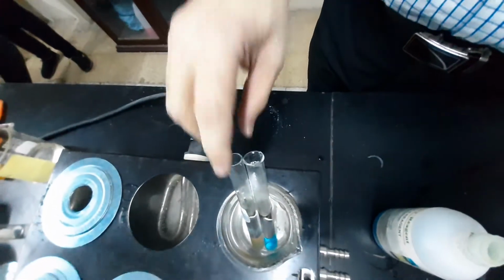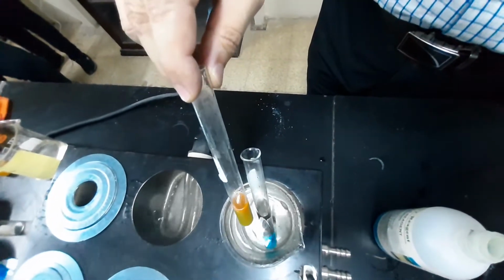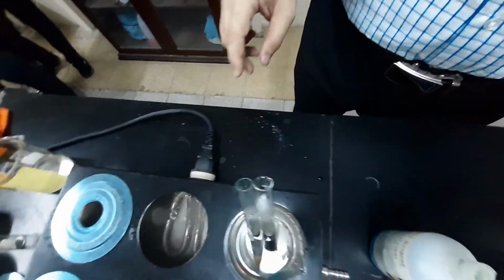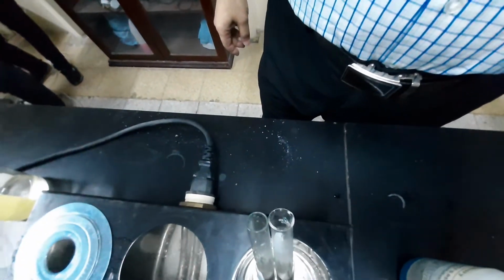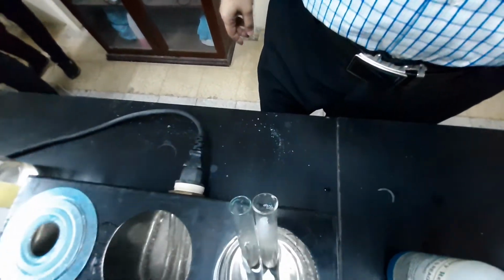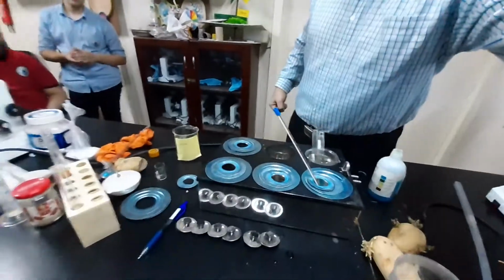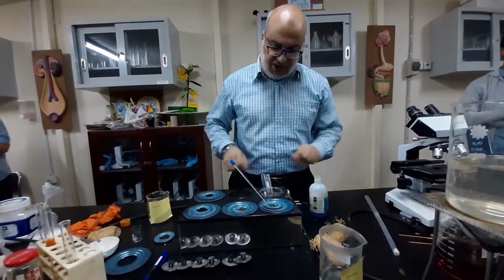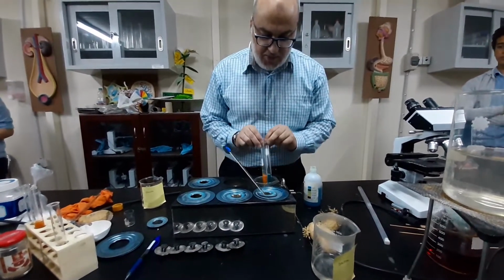One of them started to change. Look at the change from blue to yellow, then now it's still in the green. And from green towards the orange, then the brick red. If this happens, the sugar we tested is a reducing sugar and contains a considerable quantity of this reducing sugar. Now it's less than 5 minutes and I can see the color is changing quite clear. Look.